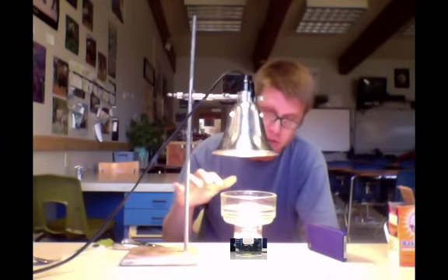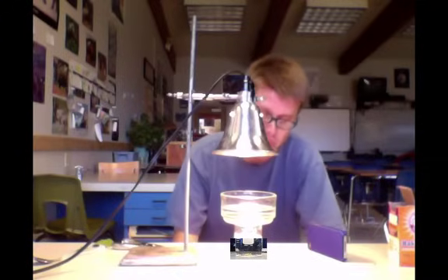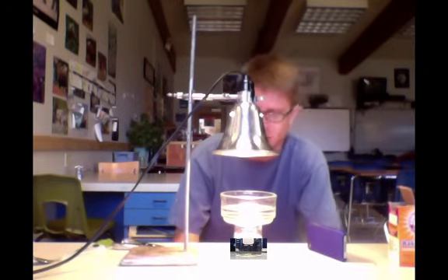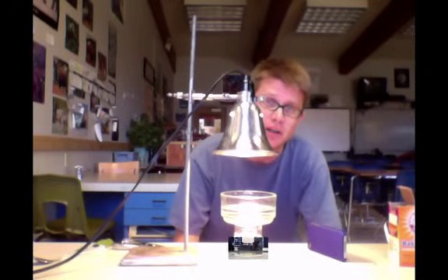You could imagine if I had more amounts of light, that's going to speed up the rate of photosynthesis. I'll probably have to speed up the video. It takes a few minutes, sometimes four or five minutes, depending on how far the light is away. But I'll speed it up and you can check out the leaf chads floating.